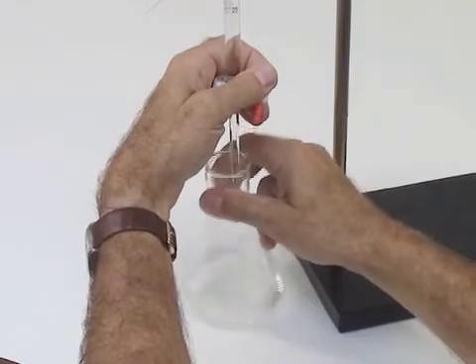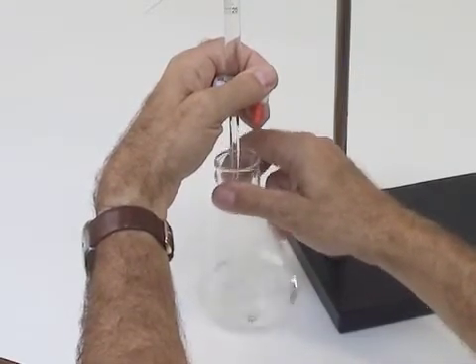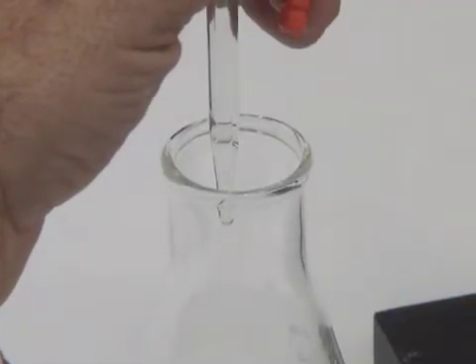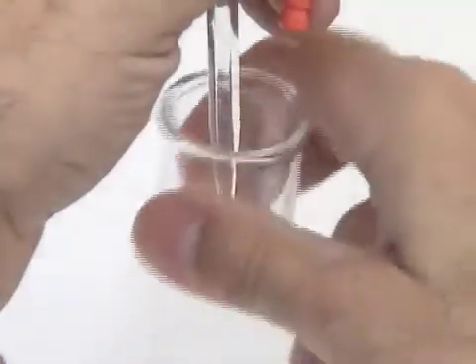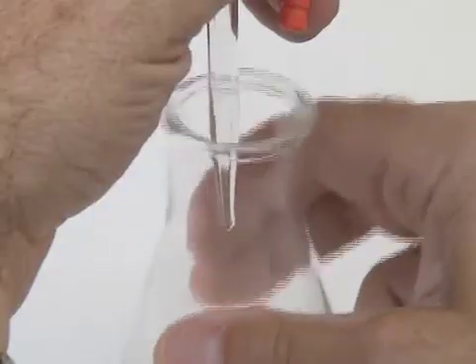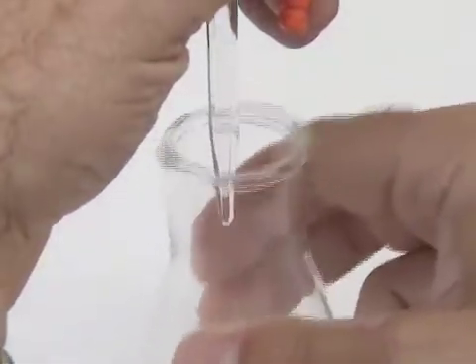Notice how the left hand manipulates the stopcock of the burette to control the flow. The right hand mixes the solution quite rapidly. The objective is to mix the drops faster than they're being added. The persistence of indicator color in the solution allows us to judge when we're getting very close to the end point.